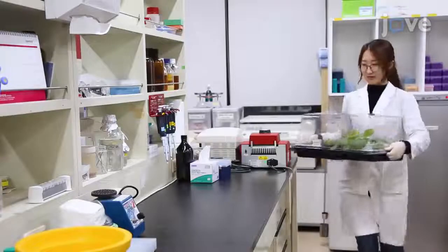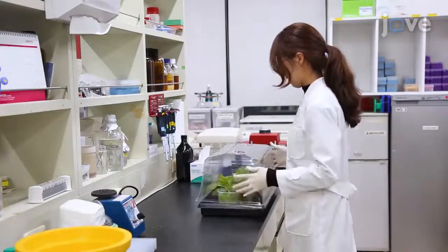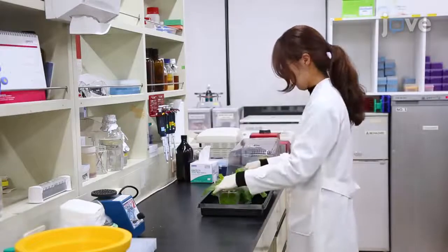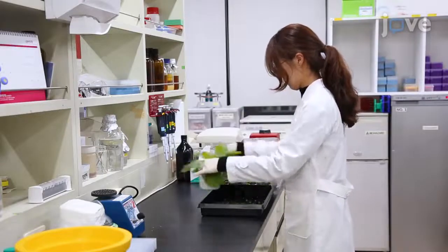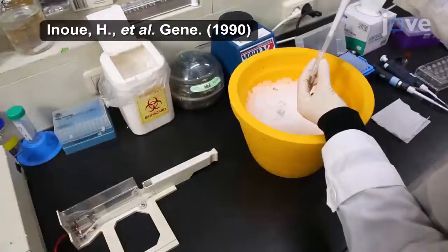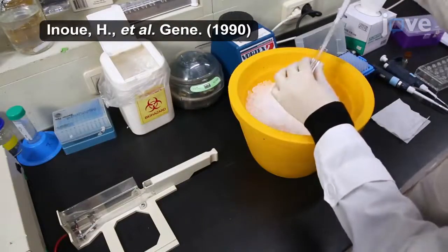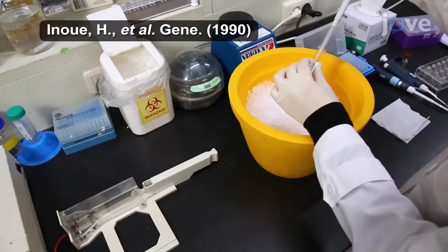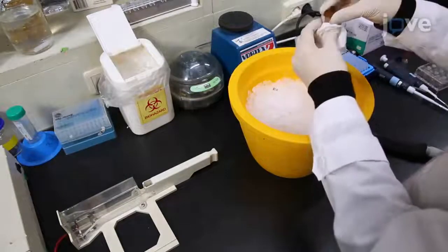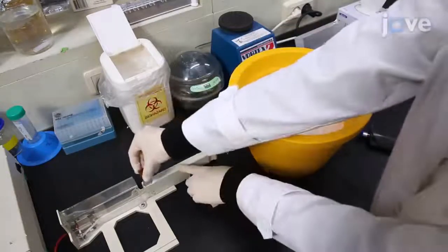To begin this procedure, prepare Nicotiana benthamiana and Arabidopsis thaliana plants as outlined in the text protocol. Next, use standard electroporation to transform the plasmid carrying an effector gene fused to the SFGFP11 tag to Pseudomonas syringae pv. tomato DC3000 strain.